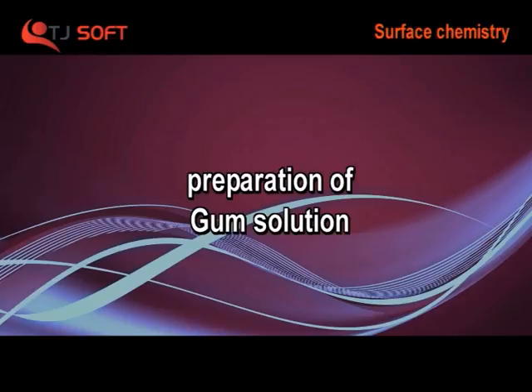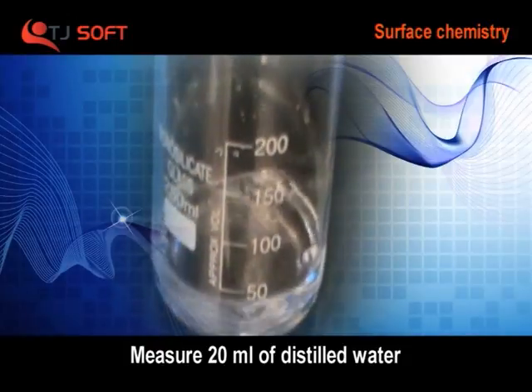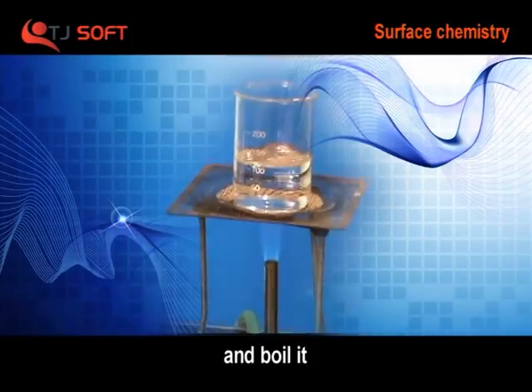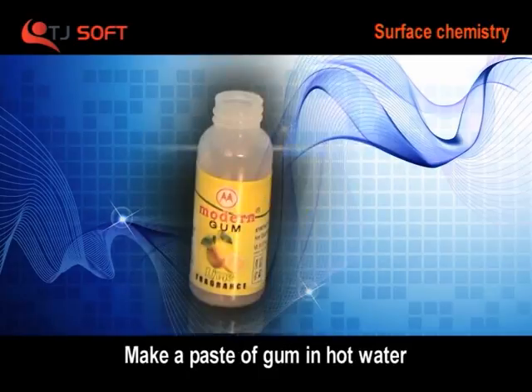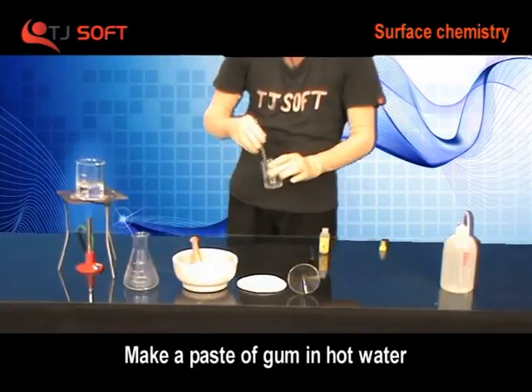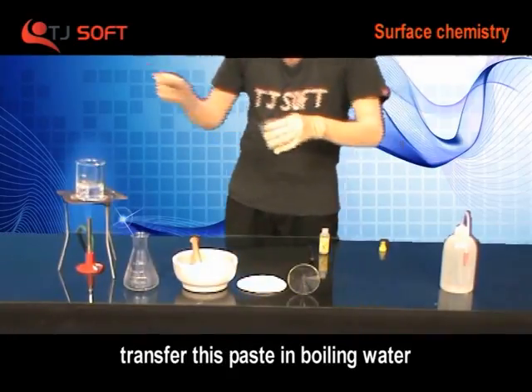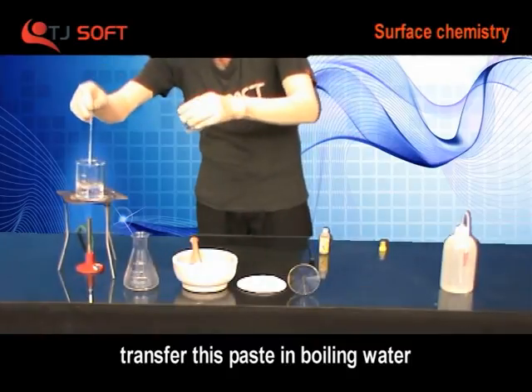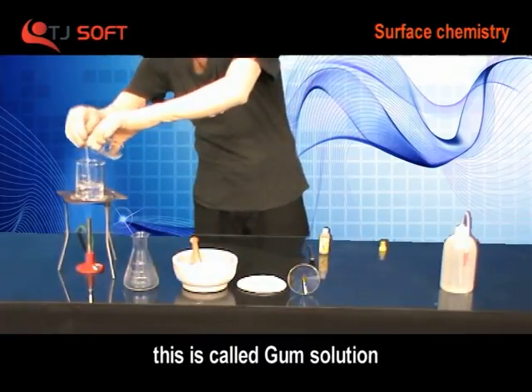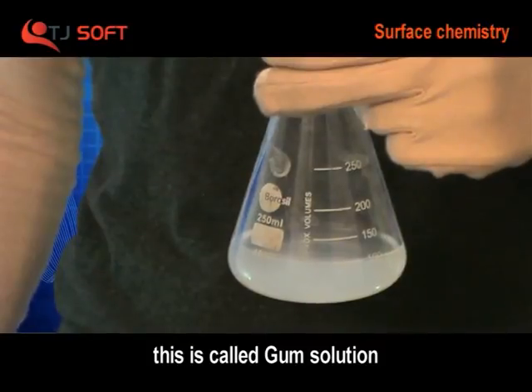Preparation of gum solution: Measure 20 ml of distilled water with the help of a beaker and boil it. Make a paste of gum in hot water. Transfer this paste into boiling water with constant stirring. The solution formed is called gum solution.